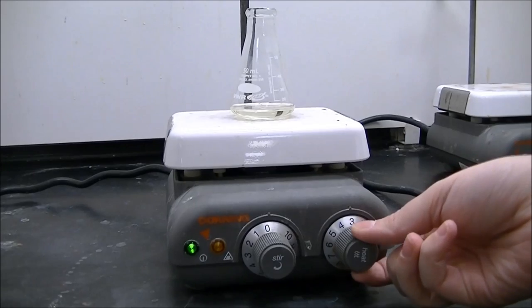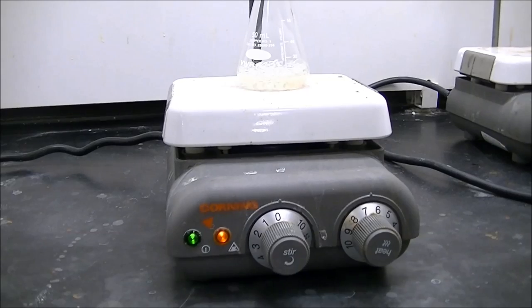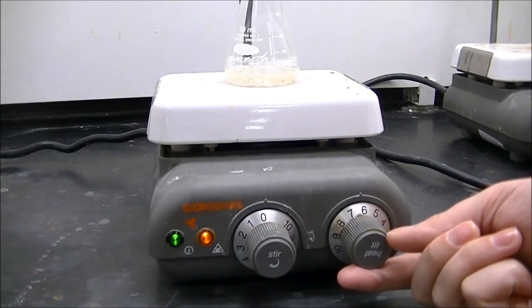Under the fume hood, boil off your methylene chloride. The boiling point of methylene chloride is only 40 degrees Celsius. So if you see it over boiling, reduce the heat.